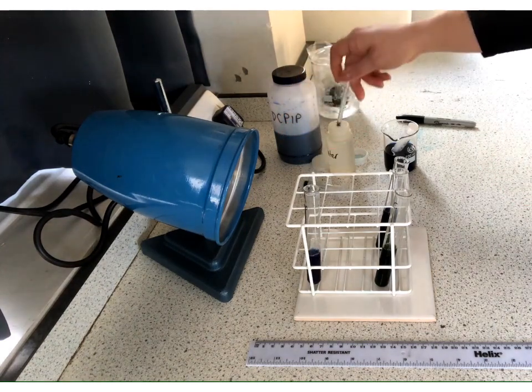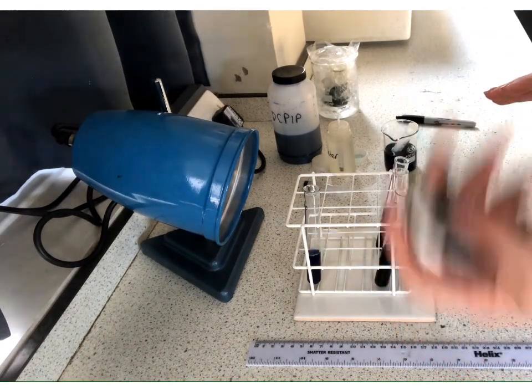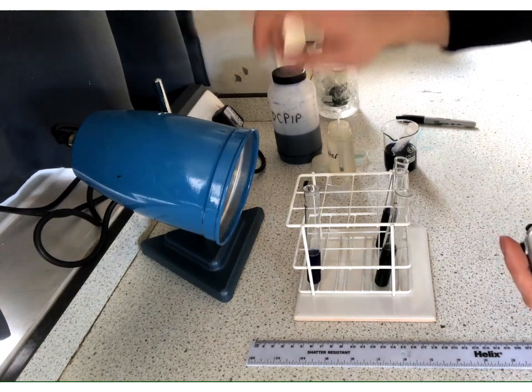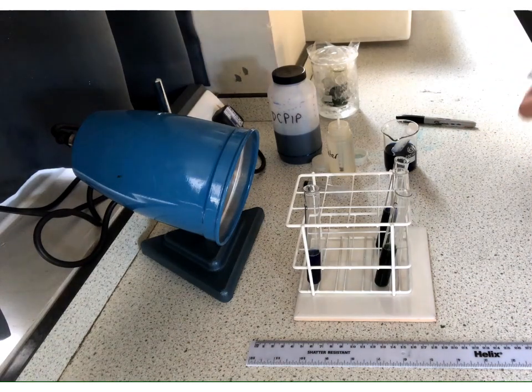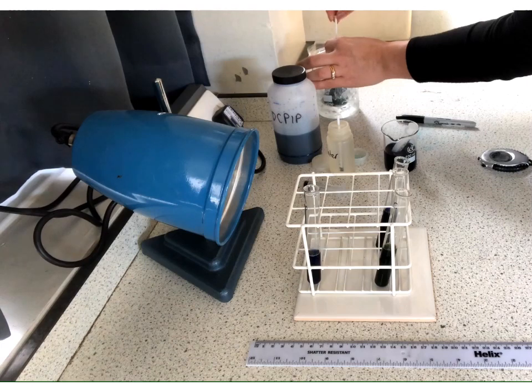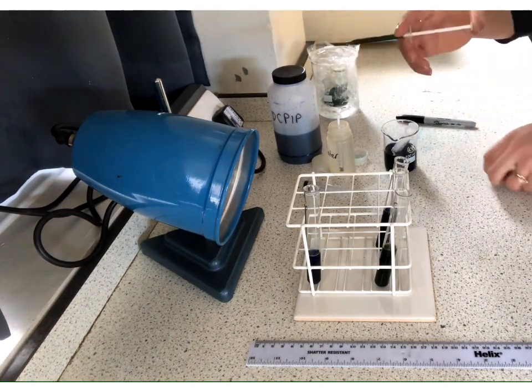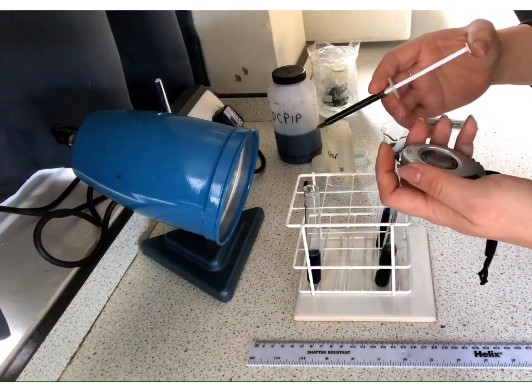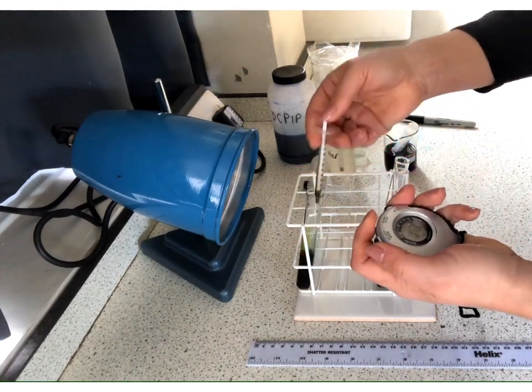Okay, and then these next parts, we need to do them quite slick or quite quickly. So we're going to have to start. We're going to have to also simultaneously hopefully add the chloroplast and switch on the light so that we can really try and capture the right time and be as good as possible. Now, ideally, we'd be doing repeats of all of this. If you were here and we were doing it as a class, we would be sharing our results. So, chloroplasts. Hopefully I can get this to work properly and also switch on the light. So here we go. Start.